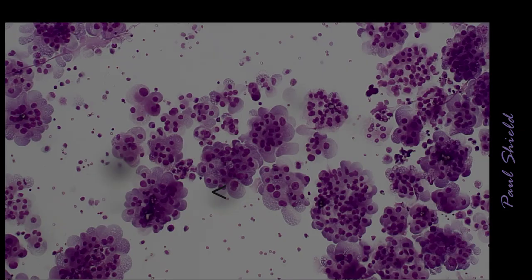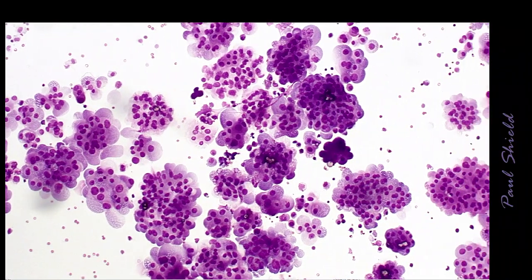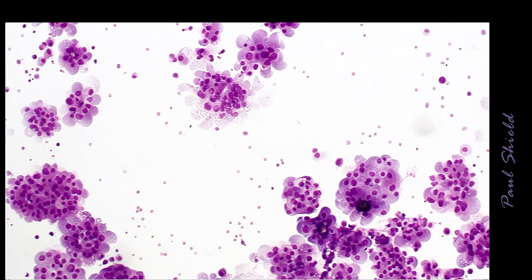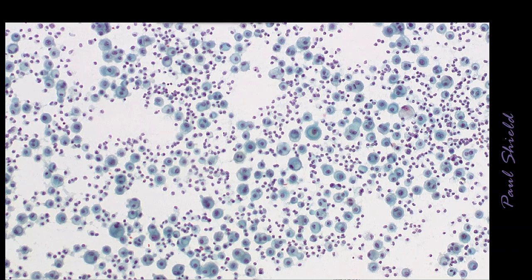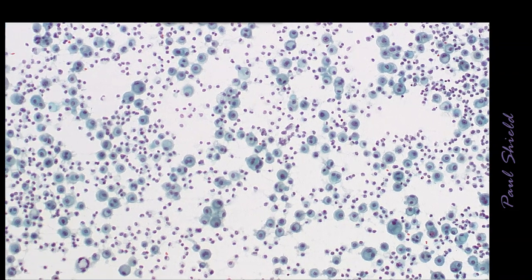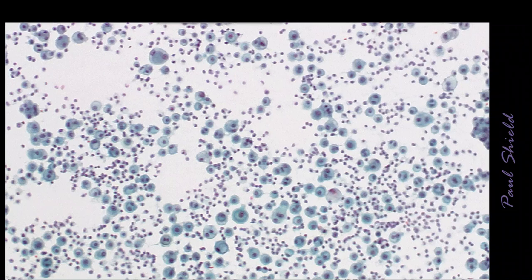This is an interesting case, so it's really showing overexpression of normal mesothelial products and characteristics. Notice the big blebbing cytoplasm on these. This is a lot more single cell arranged than the other cases we were looking at. It does still have a few big groups like this.